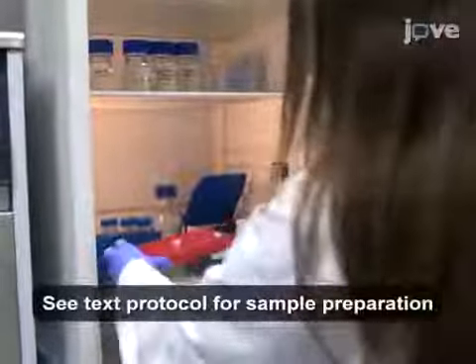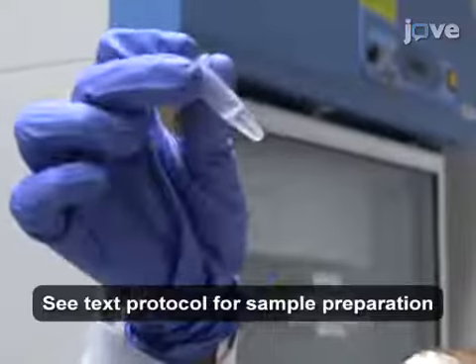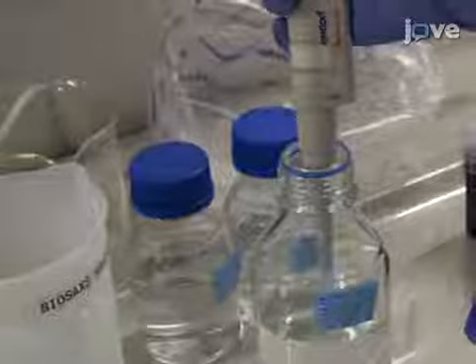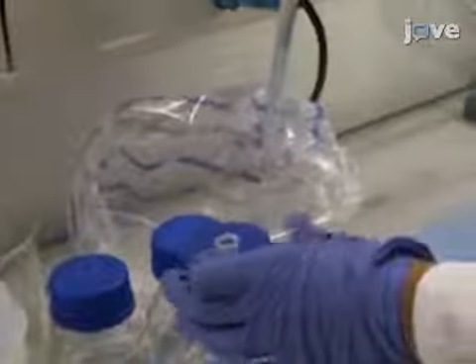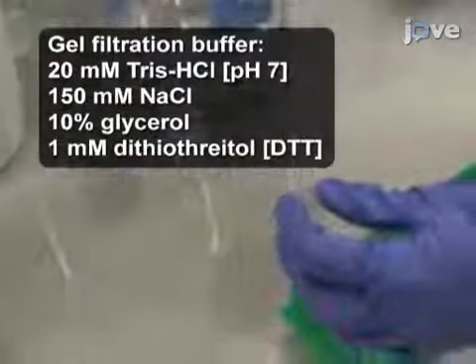Before going to the Beamline facility, prepare a concentrated sample using previously published methods and perform SEC test runs. At the Beamline facility, place 1 ml of gel filtration buffer in a 1.5 ml reaction tube.